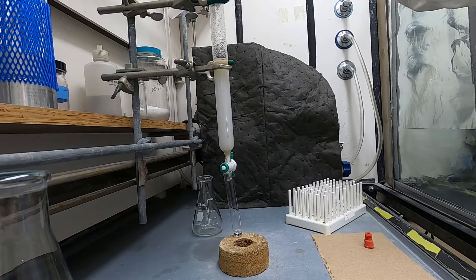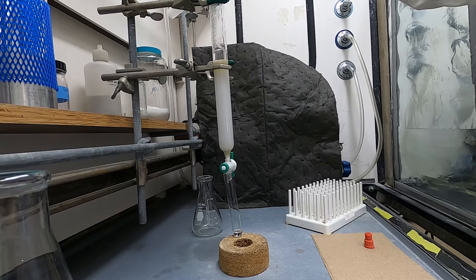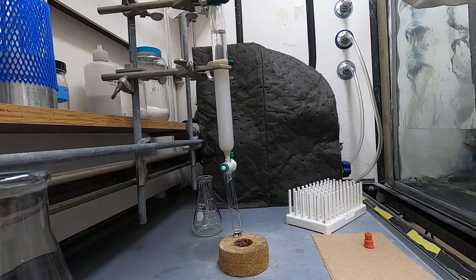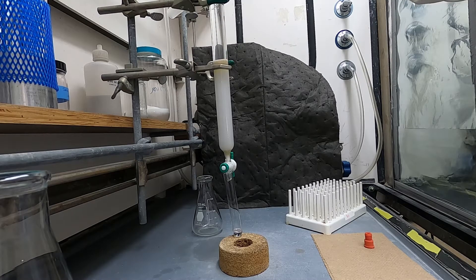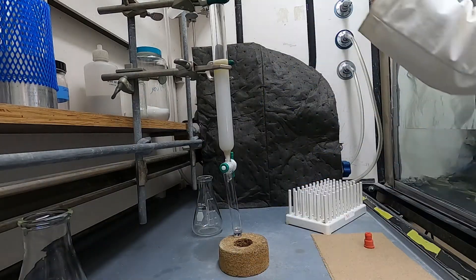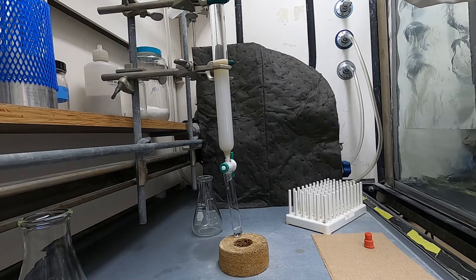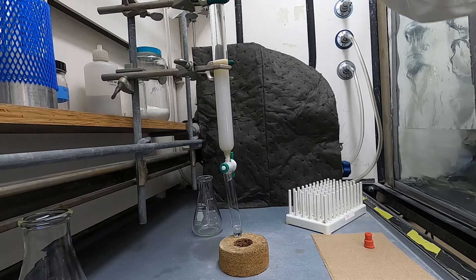So you can see when I'm adding it here the sand moves a little bit at the very top but the silica underneath was not disturbed at all. And then once you get enough mobile phase above the surface of silica you can just add it as fast as you want.